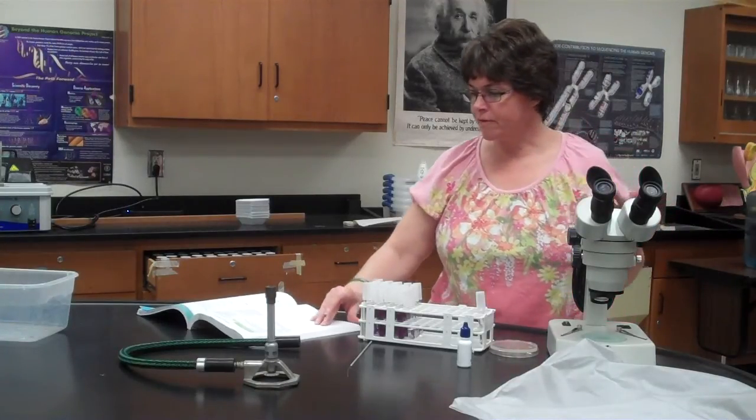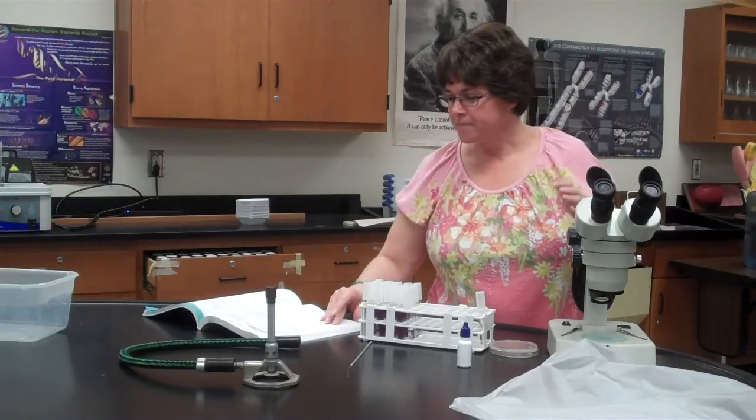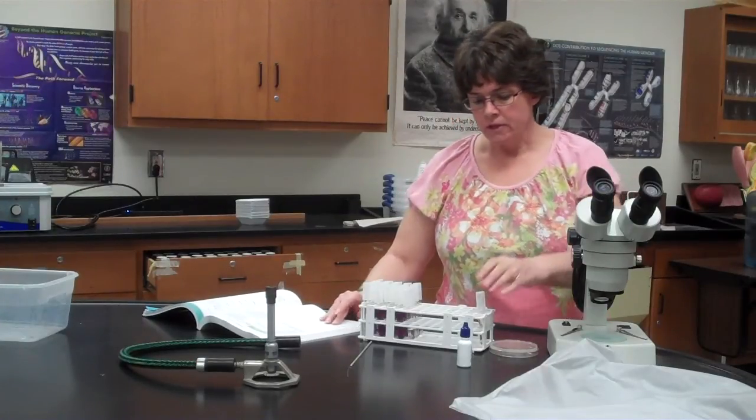And you'll use your lab manual and the characteristics in the lab manual, and also what we talked about in lecture, to figure out which mold it is. Now, the lab manual has several different possibilities. However, there's some that we do not have. On the day of the lab that we do it, I will tell you the specific species, but I'm imagining it wouldn't be more than 5, okay? So there's going to be 5 possibilities, roughly, when we do the lab. So they'll be numbered. Most likely the lab person at your table will not have one of the same ones.